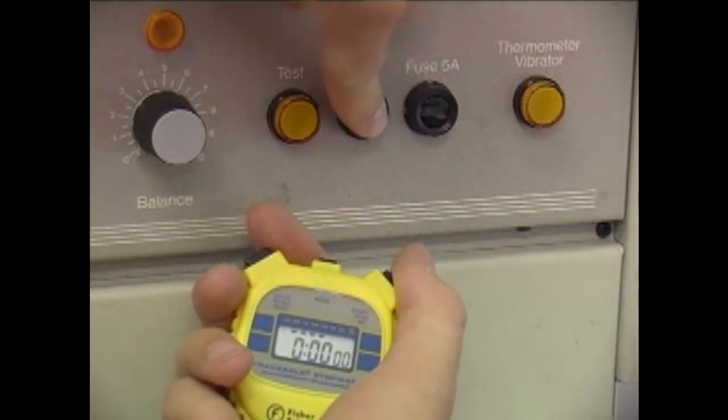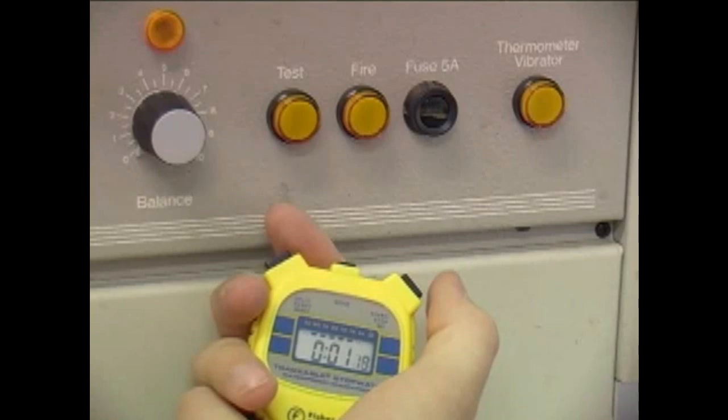Once fired, the temperature should be monitored every minute until it stops rising. At this point, the apparatus can be disassembled.